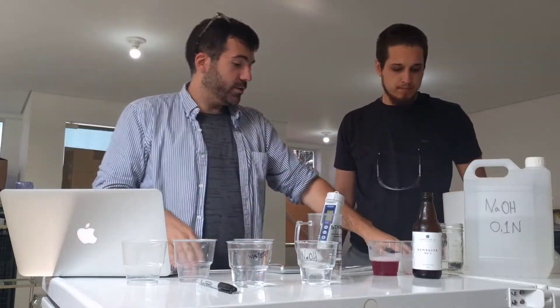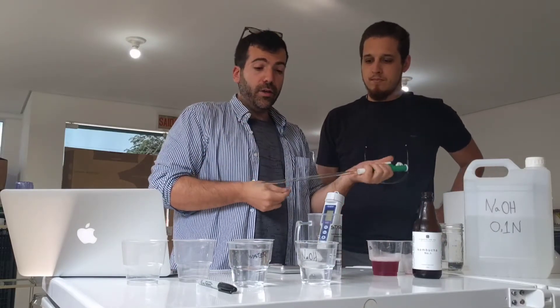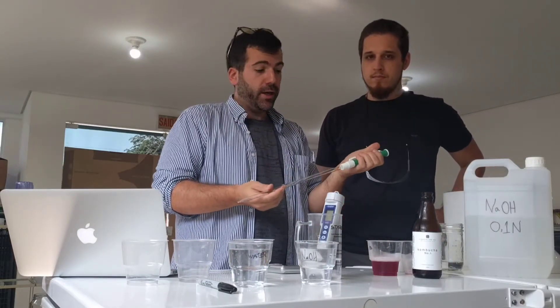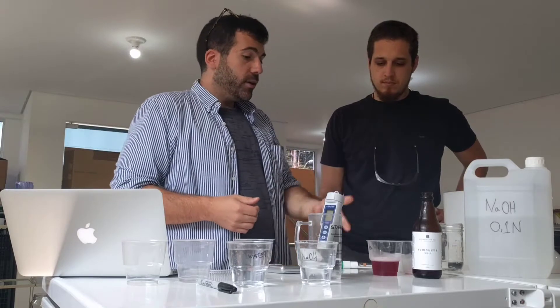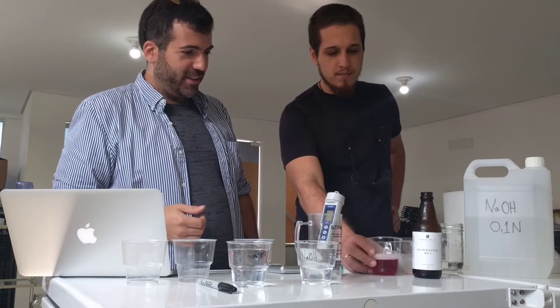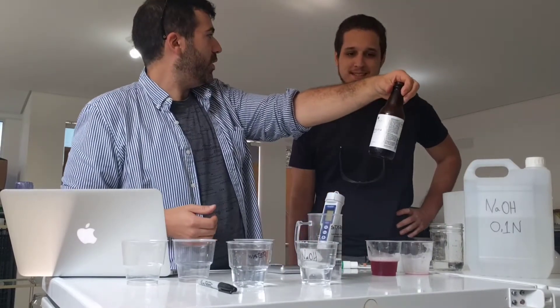And a pipette — the pipette can be used to measure exactly how much you're putting in. In this case we're just using it to pull the NaOH into the water. What flavor are we titrating today, Kayo? We're using grape. Okay, it's your grape kombucha — this is a new one on the market, right? Yeah.